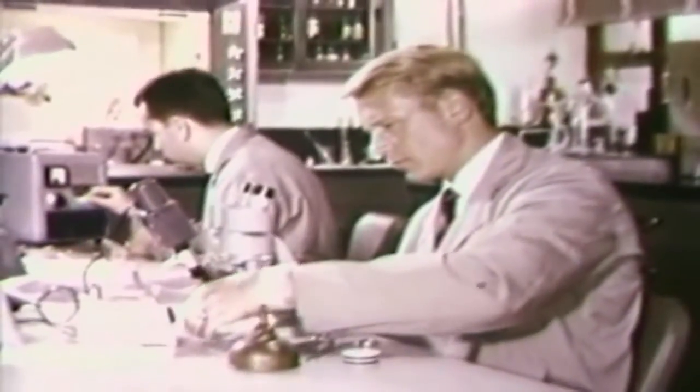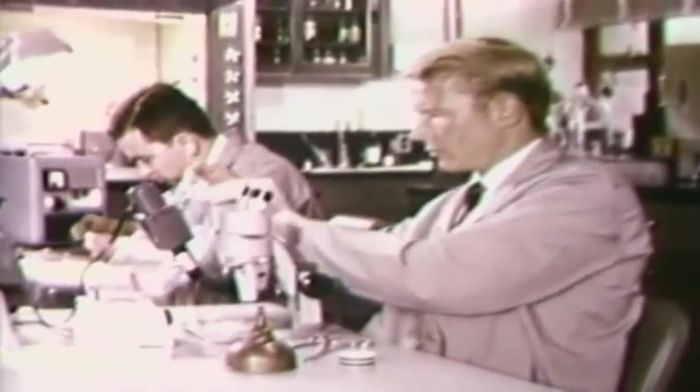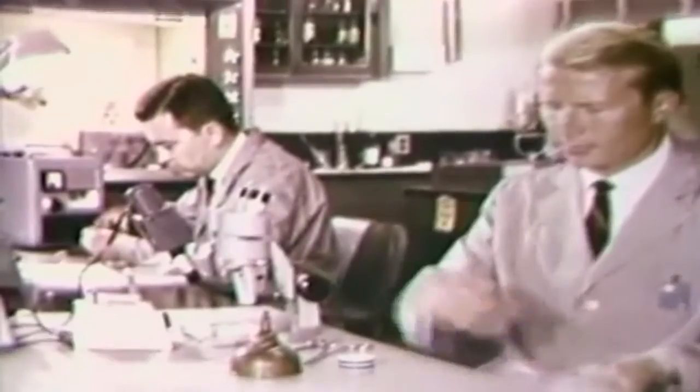Another examiner has been separating and isolating microscopic particles from a paraffin cast removed from the hand of a suspected gunman. These small particles will be made radioactive in the reactor and the elements comprising these particles will be determined.